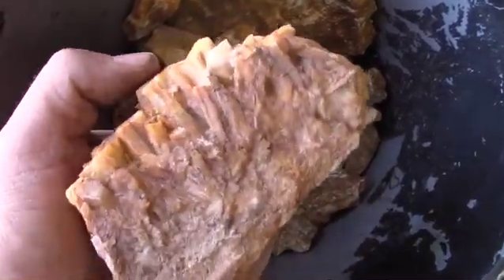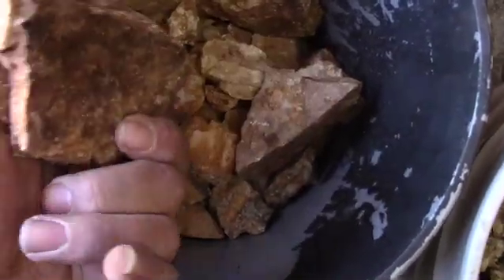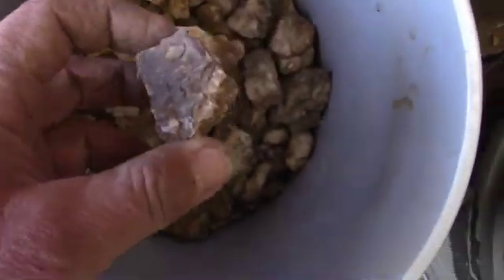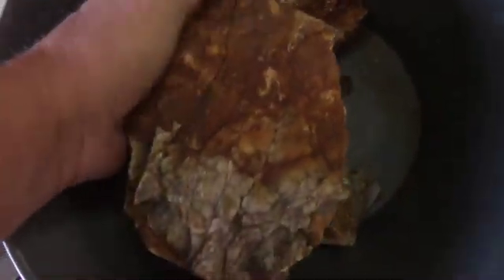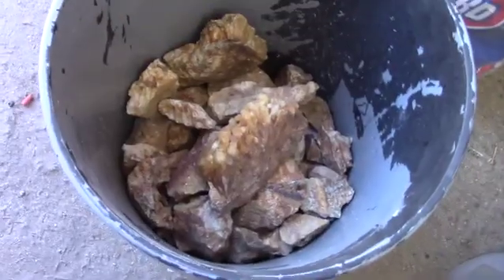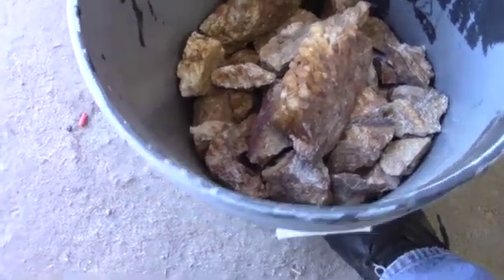Let's see if I can get some of those quartz crystals out and save them. Looks like it should have some surface gold on it. The second sample looks promising. Of course, everything looks promising when you pick it up. And the third sample, these larger rocks, they look to have some material on them. We'll look at them under the microscope and see what they show. So the sample with the crystalline rock in it, we'll call that sample A.